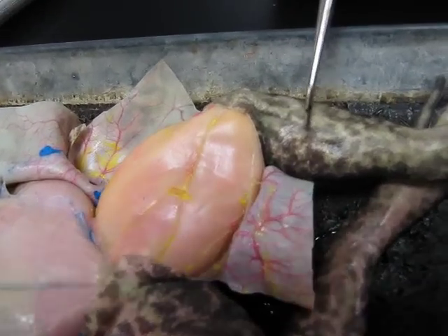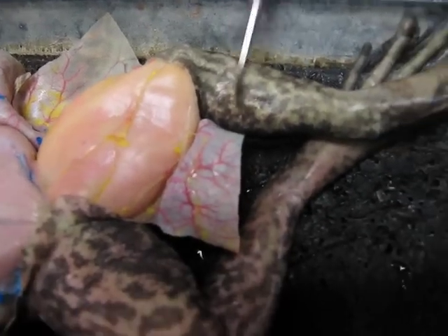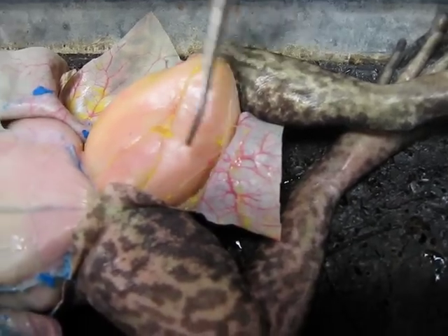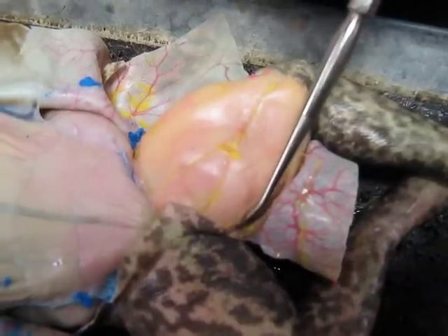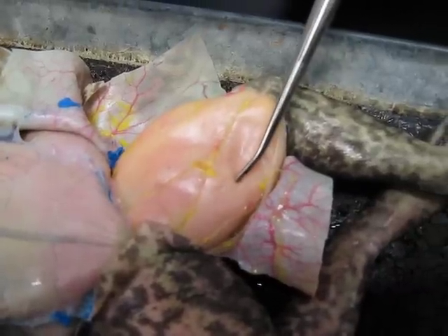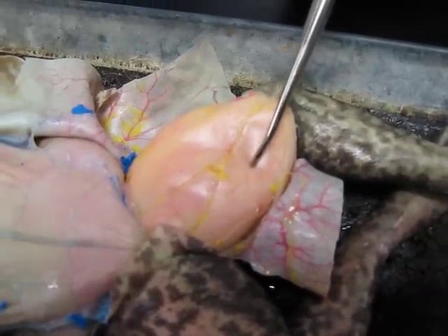This is the muscles of the frog. The calf muscle of the frog is called the gastrocnemius. Up under here, under this line right here, is the gracilis minor. Up above it is the gracilis major.